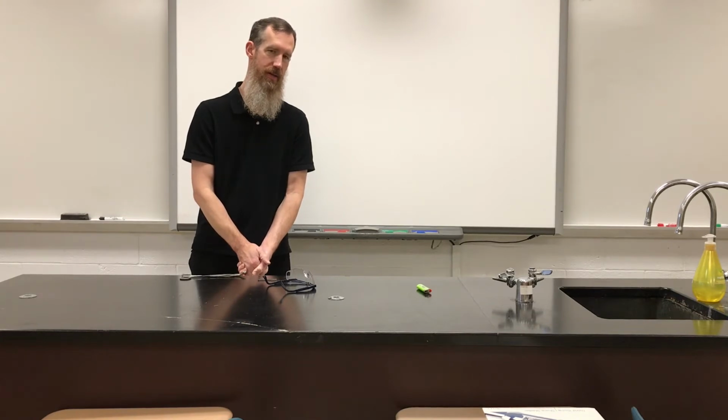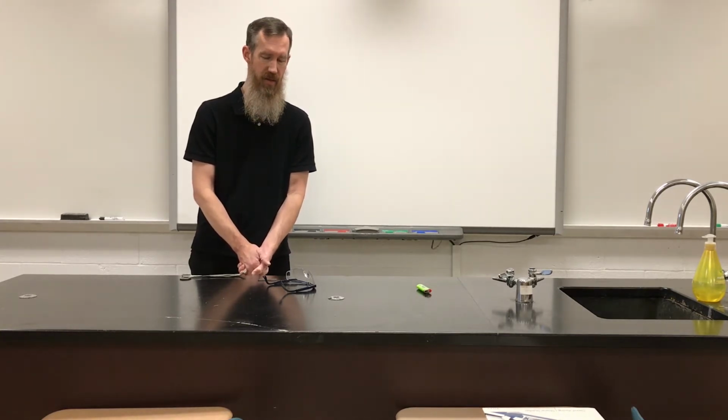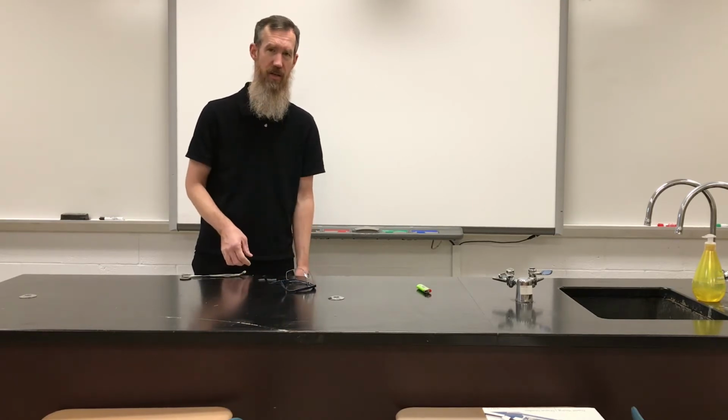Hello, ladies and gentlemen. So we're starting out in our chemical reaction unit, and today I want to show you two chemical reactions, one you're probably familiar with and the other you are not. And you're going to have a corresponding data sheet with this, and we will talk about that soon enough. But let me physically show you, as best I can in this remote setting, these chemical reactions.